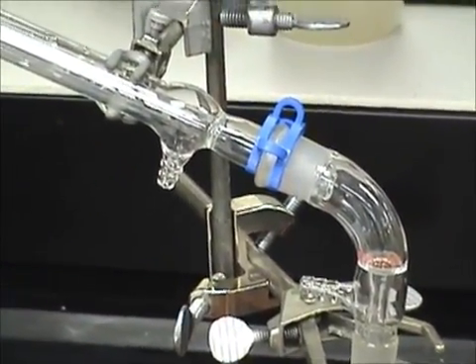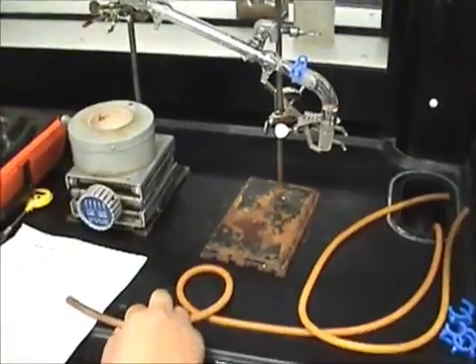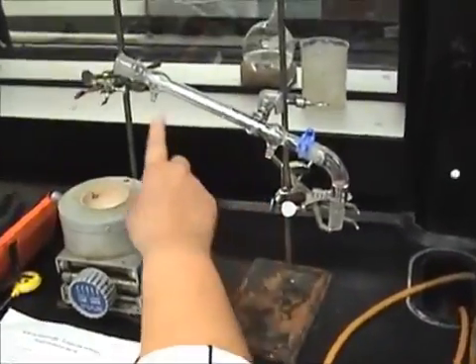Let's add on the rubber tubing for the water supply. Two tubes in all. Water enters the right side, exits the left side.